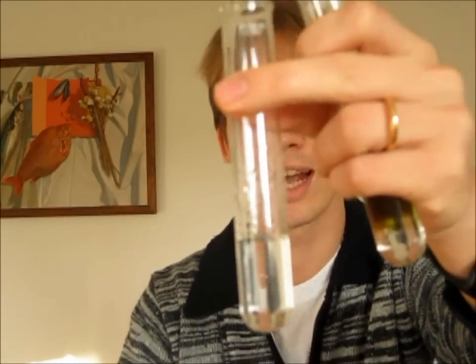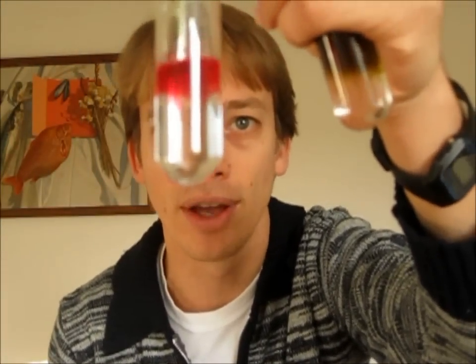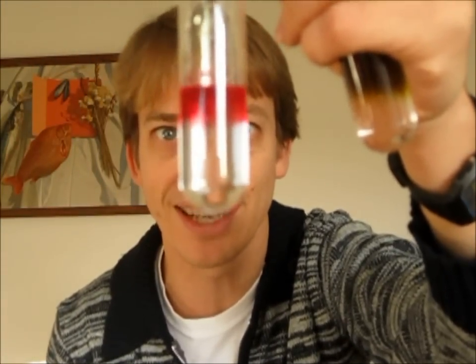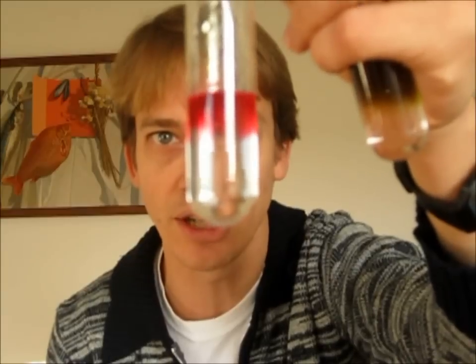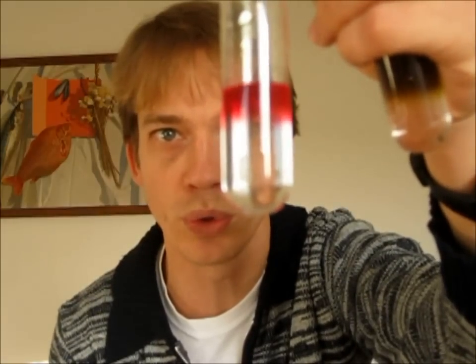Let's look at the other substance I've got here. This is hydrochloric acid. I add my universal indicator. It goes reddy pink. That tells me it's acidic — about pH 1 or 2.